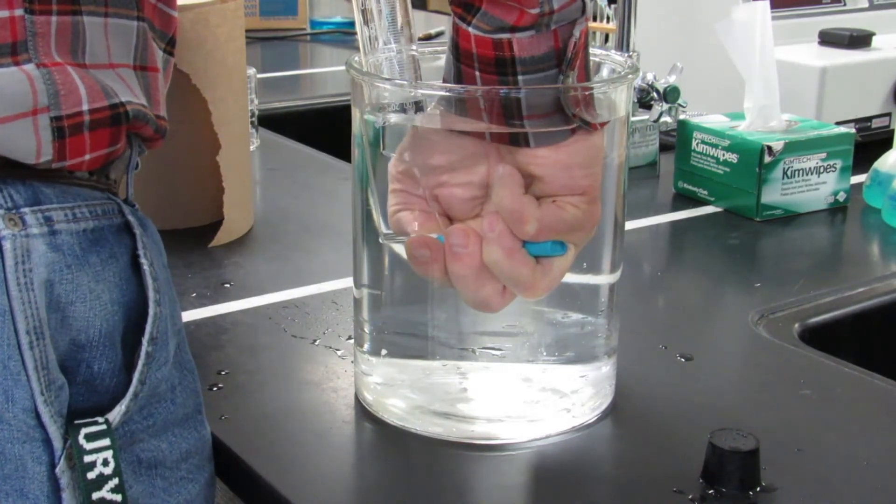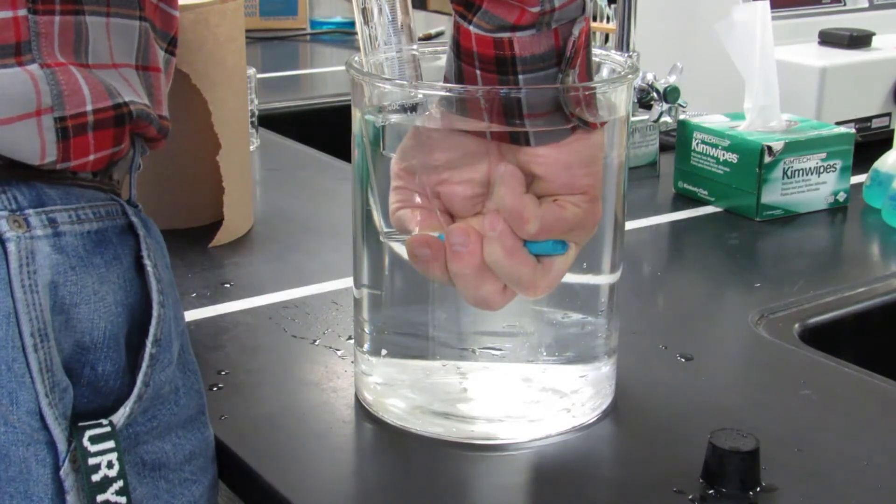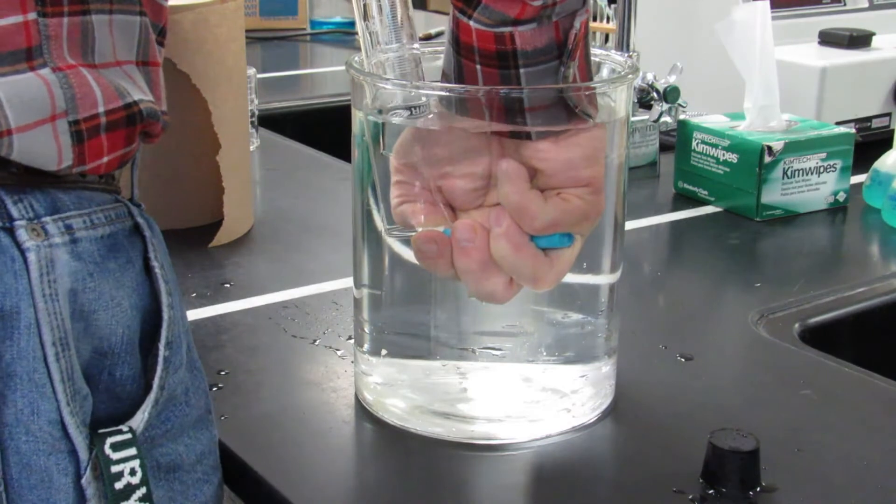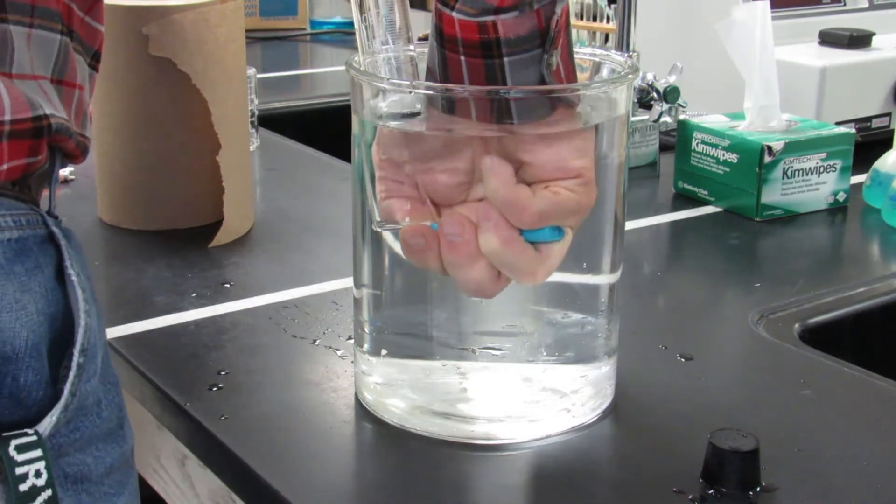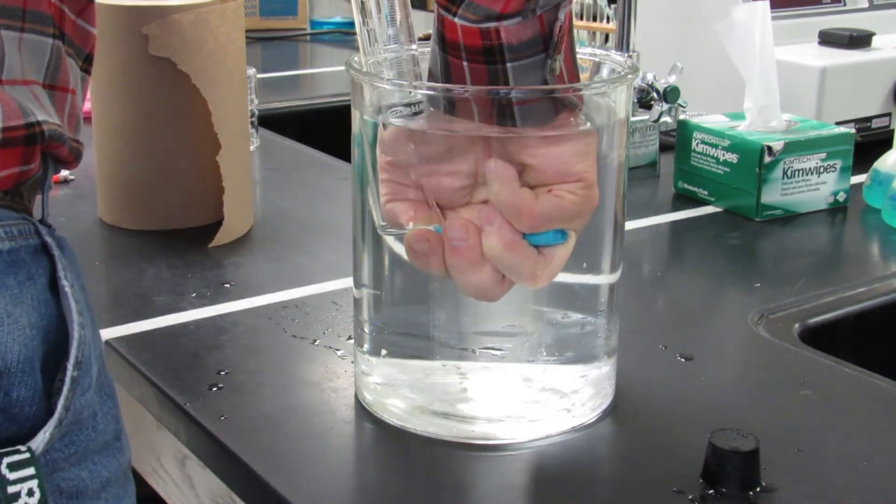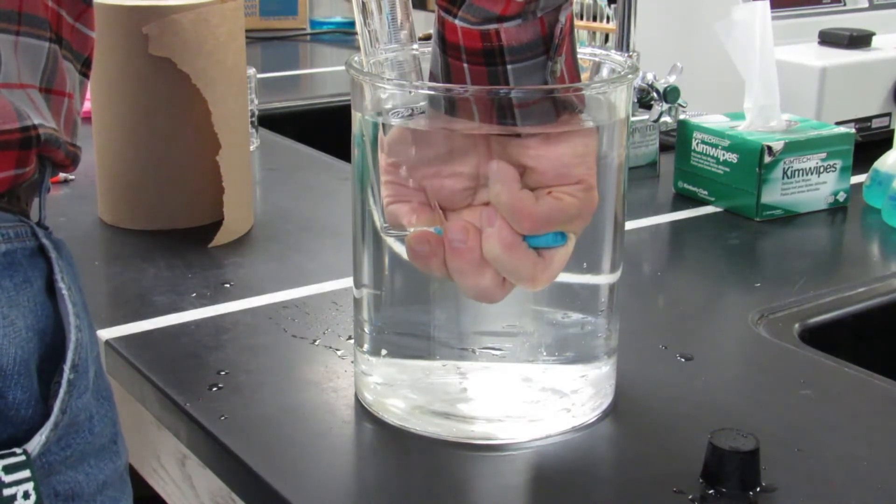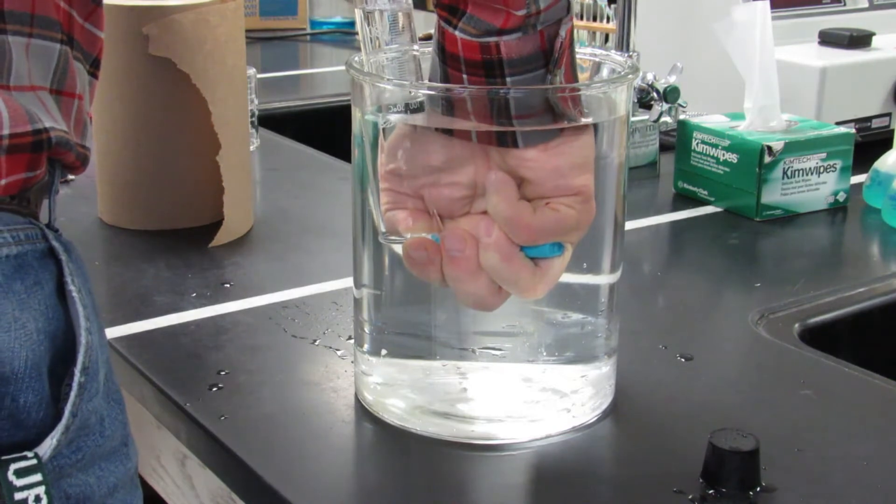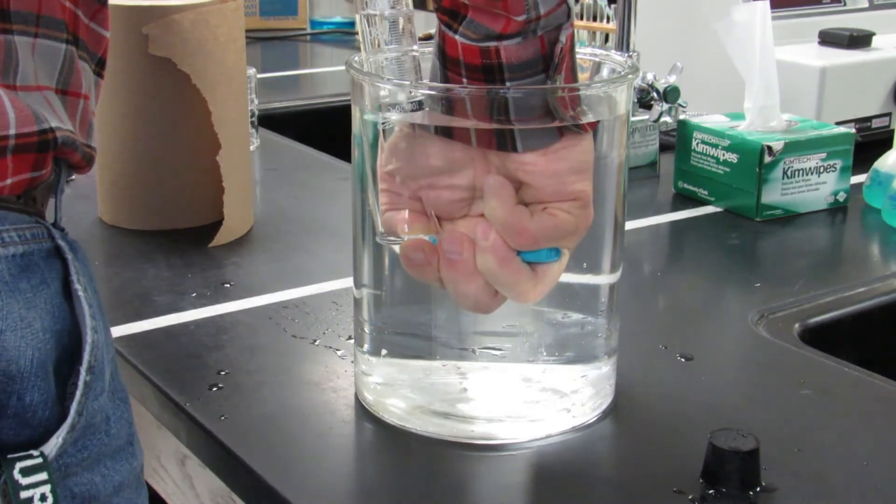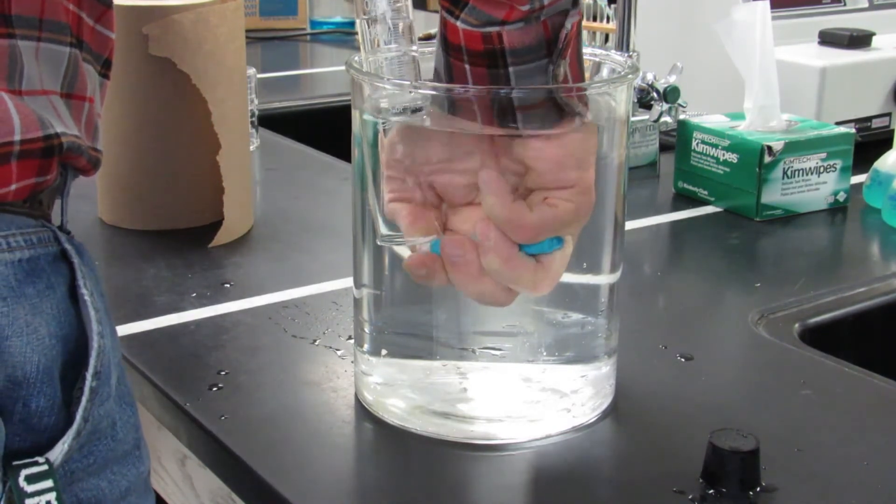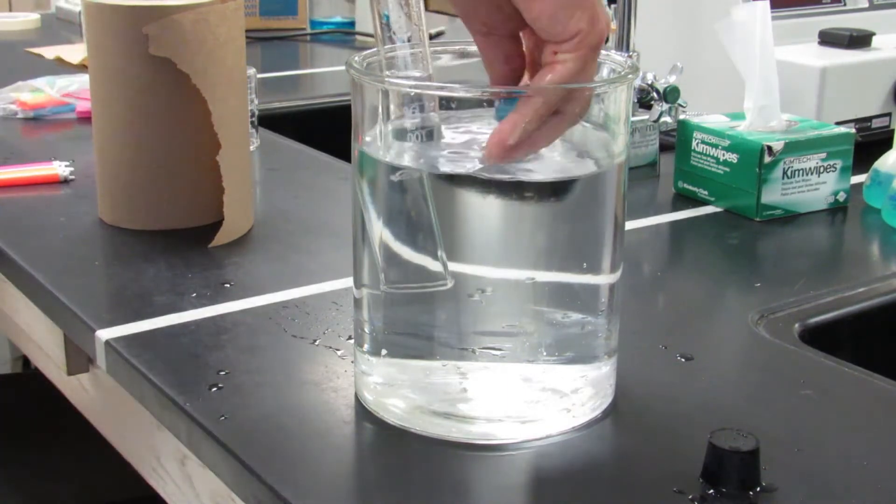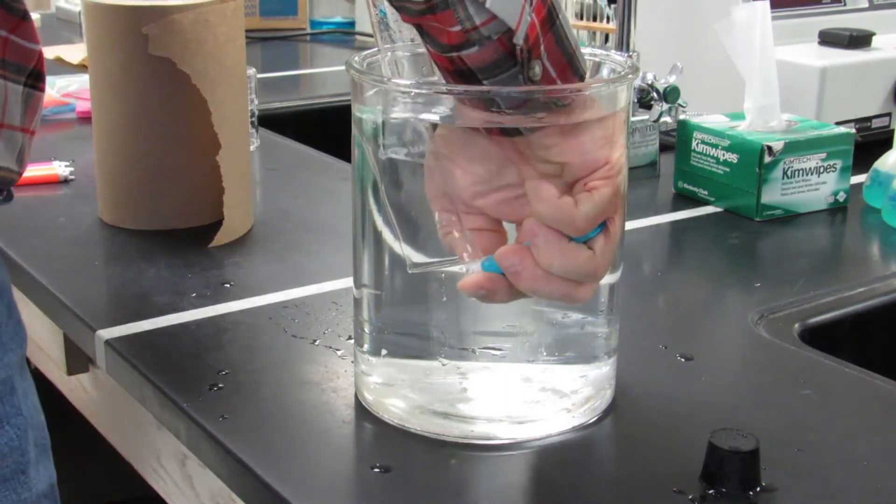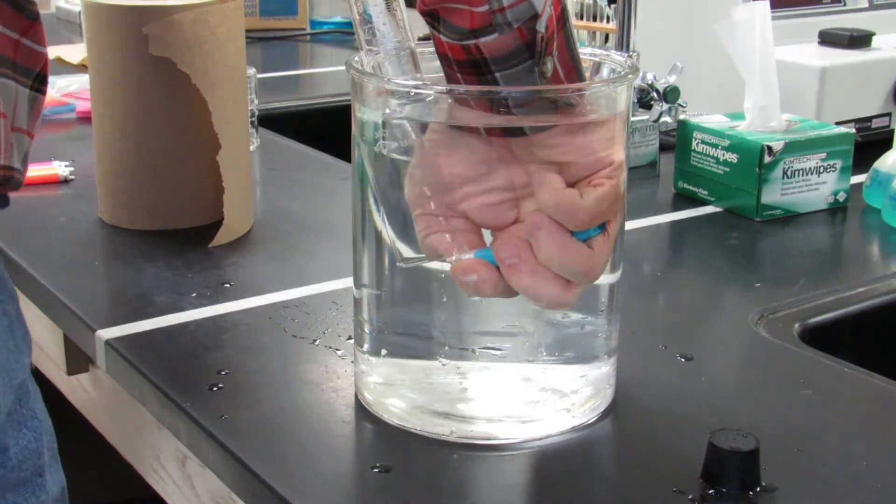Can't see the top of it yet, but I can see the bubbles still going up. Up there you see the gas at the very very top of the screen. You can see the gas filling up. That means it's probably about 80 mL now, yeah, right around 80. So I'm going to keep dispensing it until I get past the 95 mL mark.